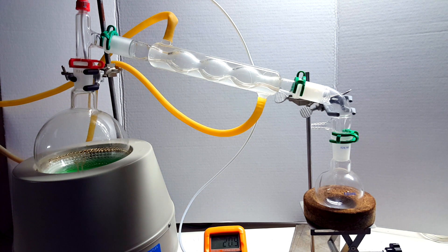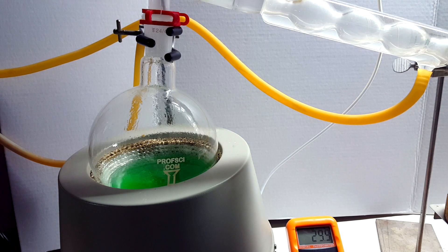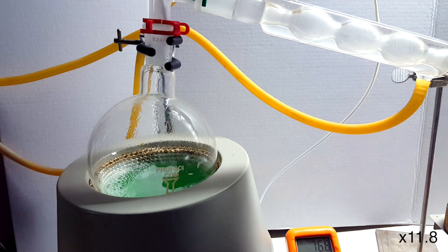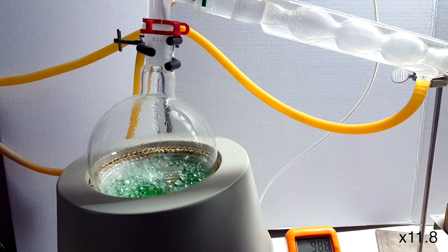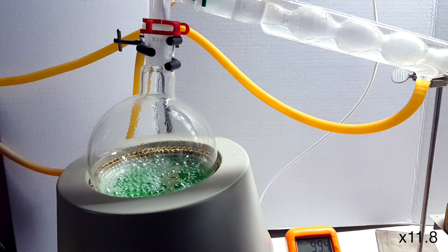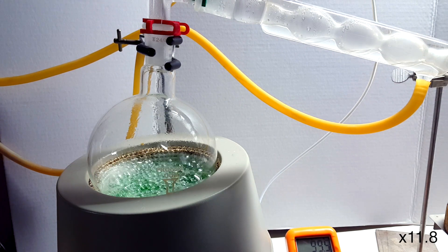The starting temperature, like it says on the thermometer at the bottom of the screen, was about 20.9 degrees Celsius. After a few minutes, some liquid began to condense on the sides of the flask at about 30°C, along with some flashes of gas. This is presumably water condensing, and gas is escaping from the solution. Just as the solution reached 60°C, the temperature quickly began to rise and vapor began condensing within the bubble condenser by 99.5°C.